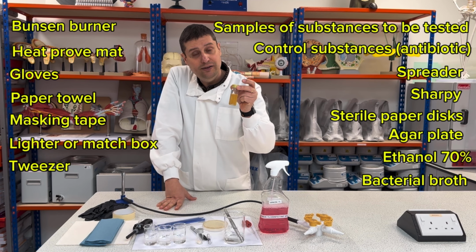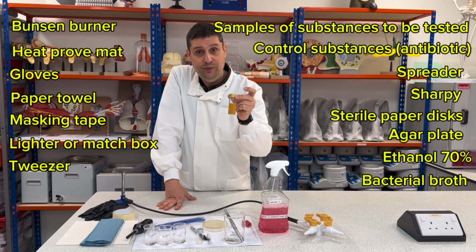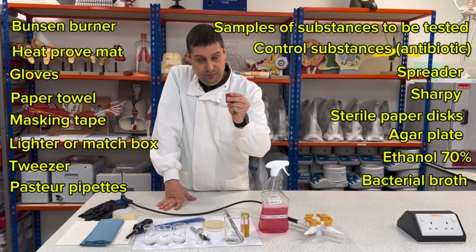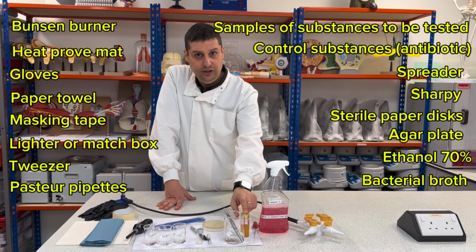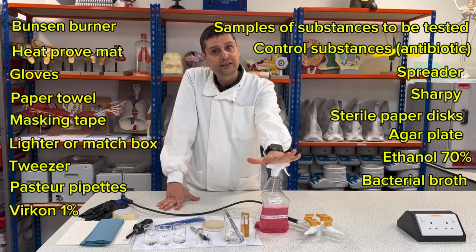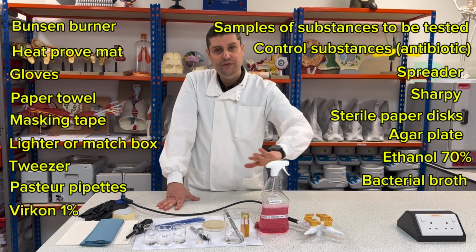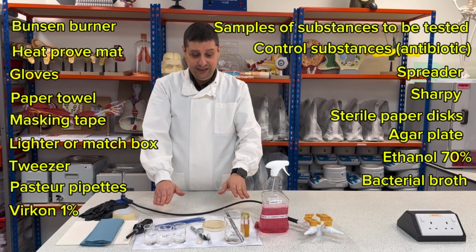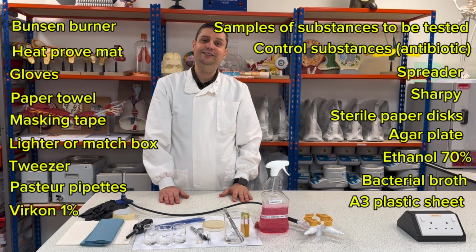my bacteria culture. Here I have E. coli, Escherichia coli, okay? A pipette to be able to suck up the E. coli broth, and Virkon 1% to disinfect the area where I will be working. And I will be working on top of a plastic A3 piece of paper, okay? So then let's go for the method.